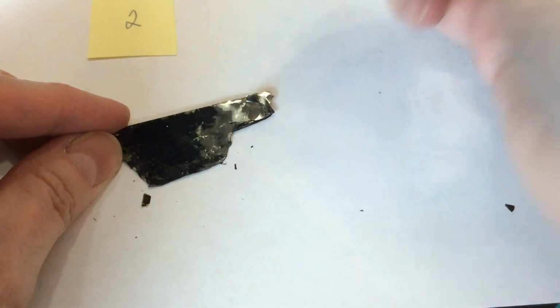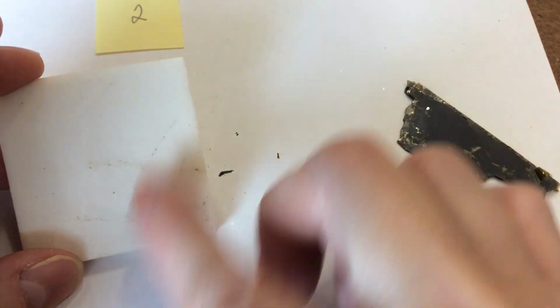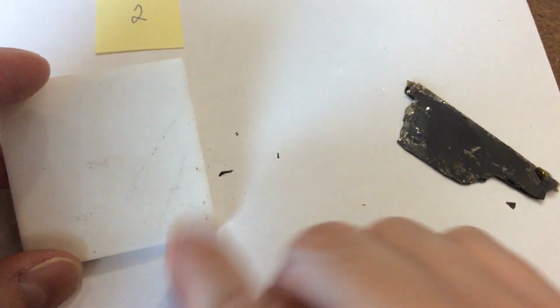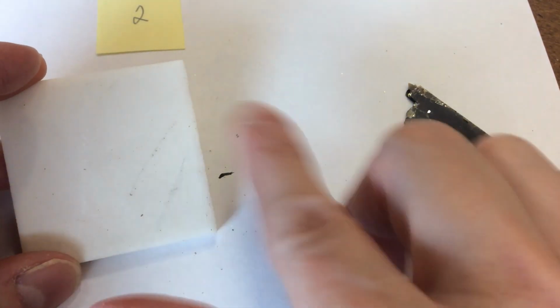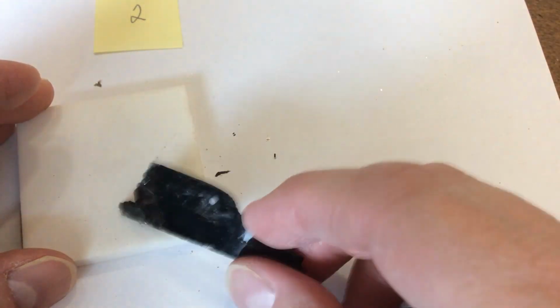It is not magnetic. And it's so soft that I'm not entirely sure whether that's just mineral that's rubbed off or not, but it has maybe brownish or maybe none for a streak. Cleaning up a little bit. Sample number 3.